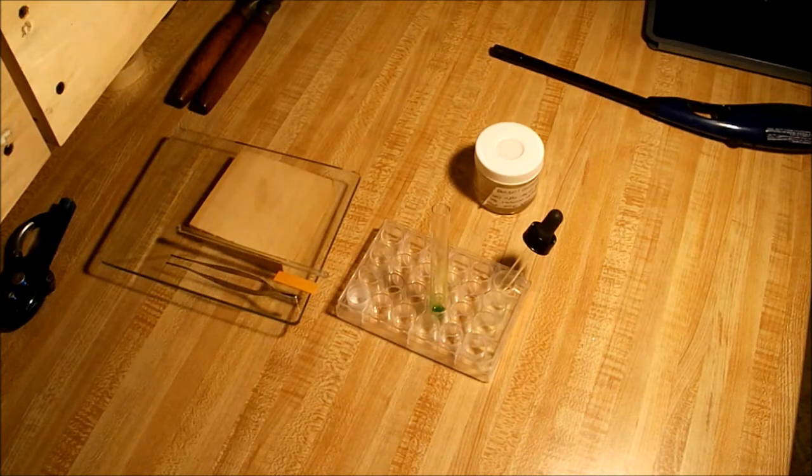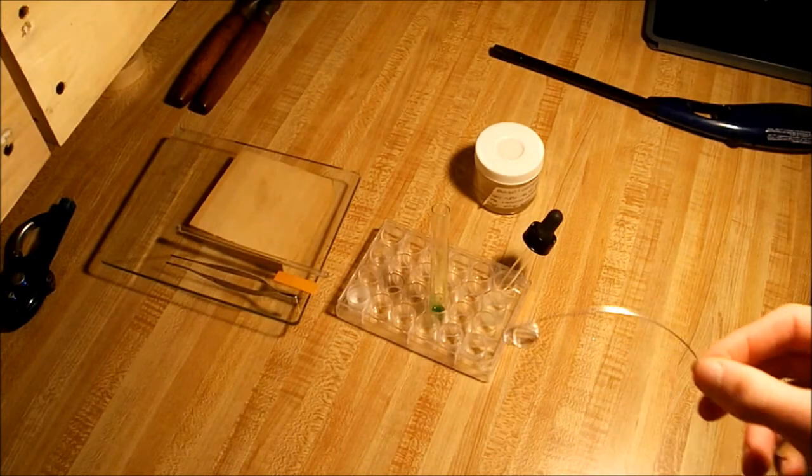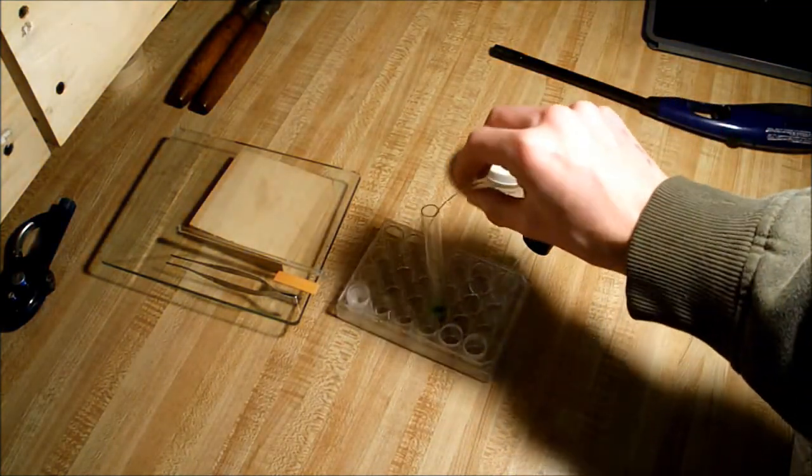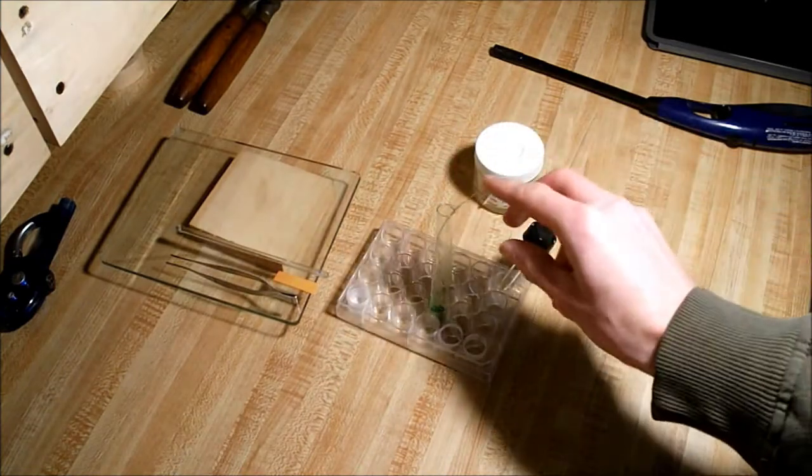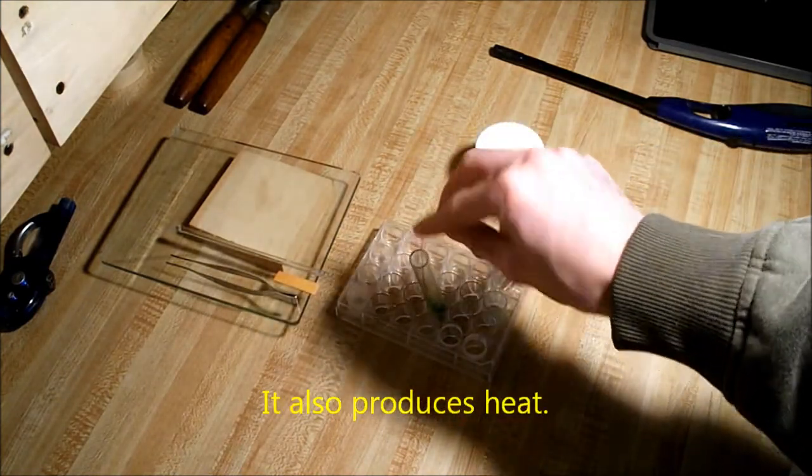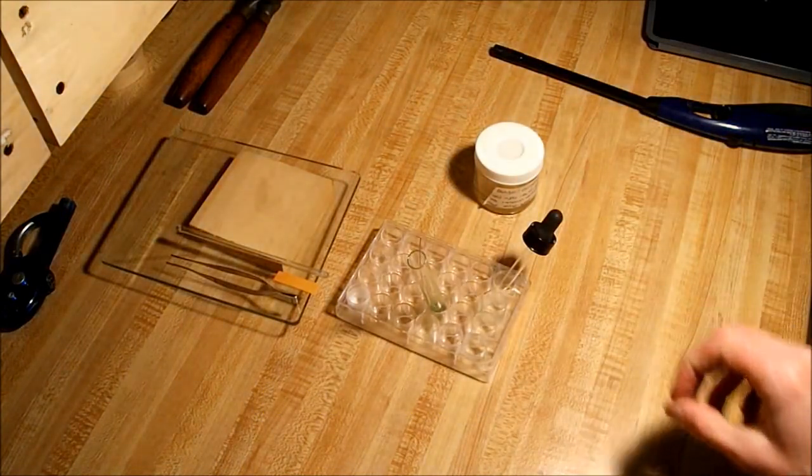Now this one is volatile as well, so anything with aluminum and hydrochloric acid is pretty volatile. So I'll place that in there.